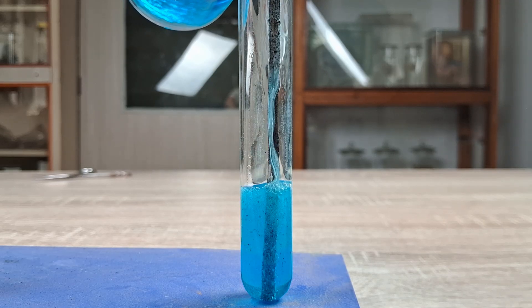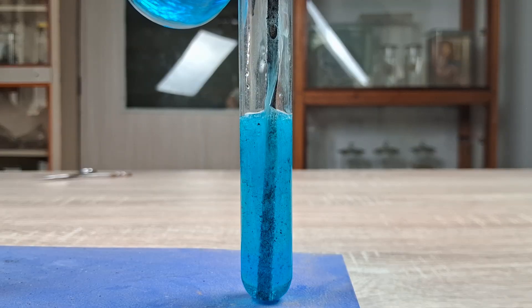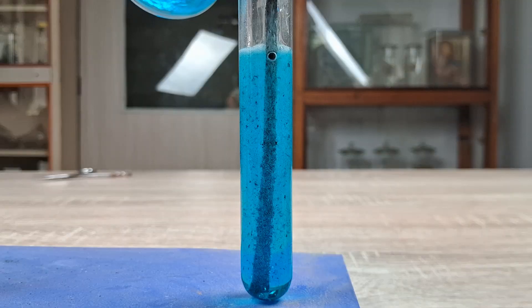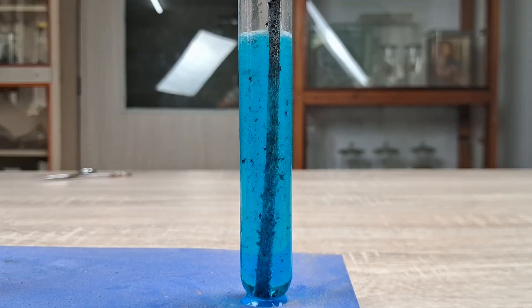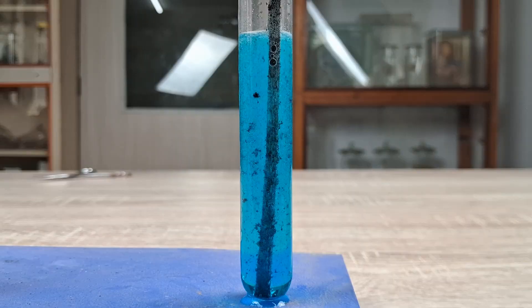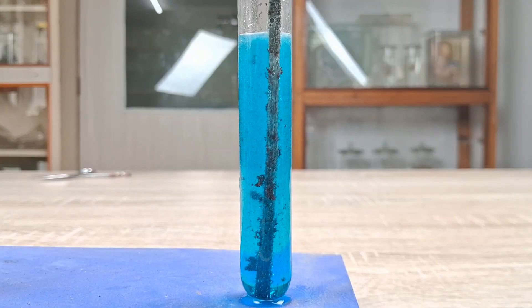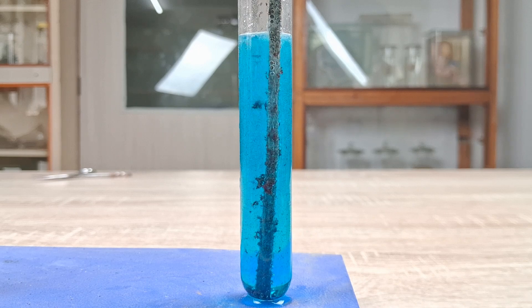Observe closely. As the magnesium metal comes in contact with copper sulfate solution, a brisk effervescent reaction occurs and bubbles are formed from the surface of the magnesium metal. Within a few minutes, reddish-brown deposits of copper metal can be seen to form on the surface of the magnesium metal ribbon.